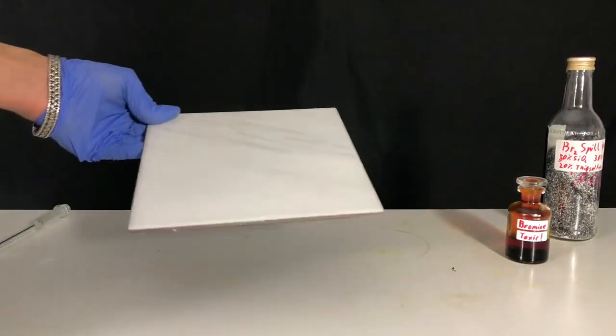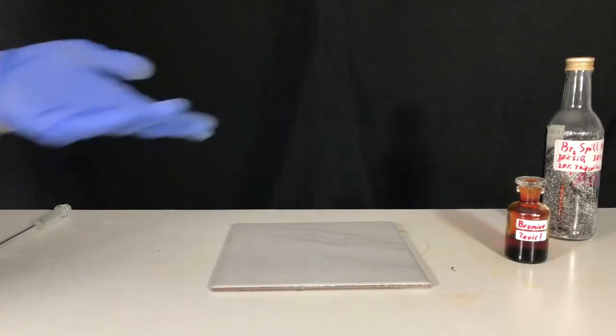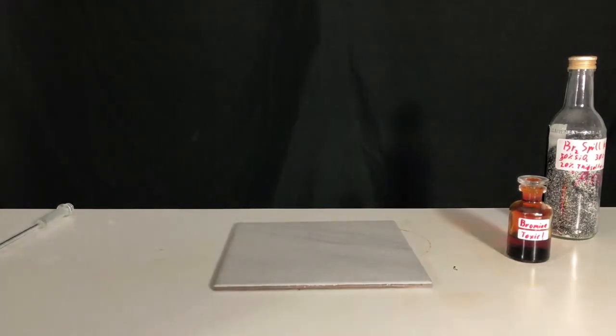But before we start, I am going to put this tile onto the table because we don't want to mess up this table even more. Also, when dealing with bromine, you absolutely have to wear a full face respirator.